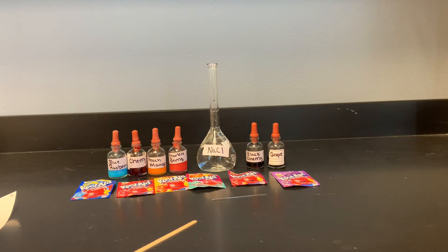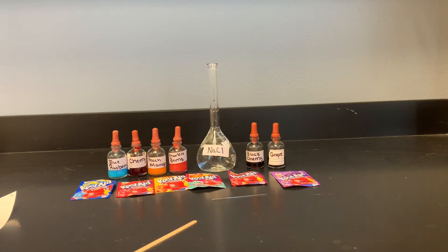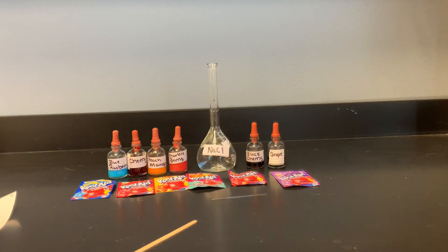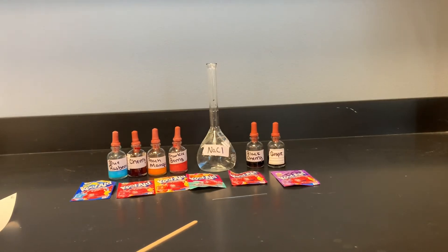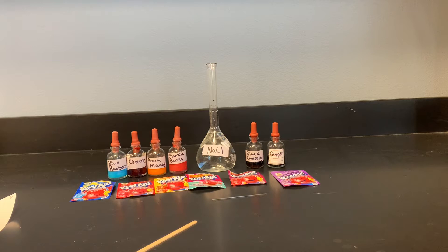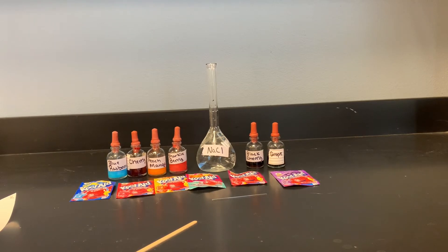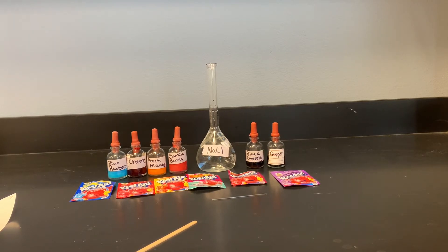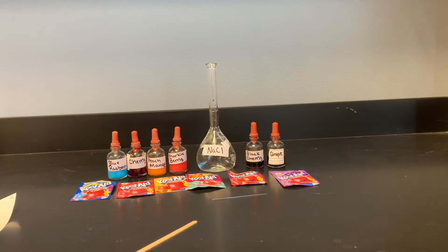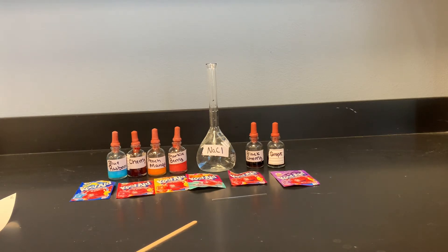As the solvent passes a spot of mixture, it dissolves the components of the mixture and carries them up into the strip of paper. The ability of the solvent to keep the solutes in solution weakens until the solutes can no longer remain in solution, and they are revealed on the paper. Because the components of a mixture have different levels of solubility, they will physically separate on the paper.